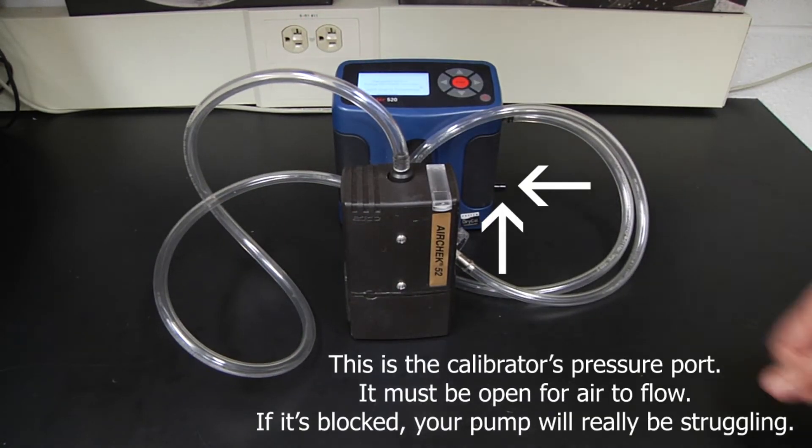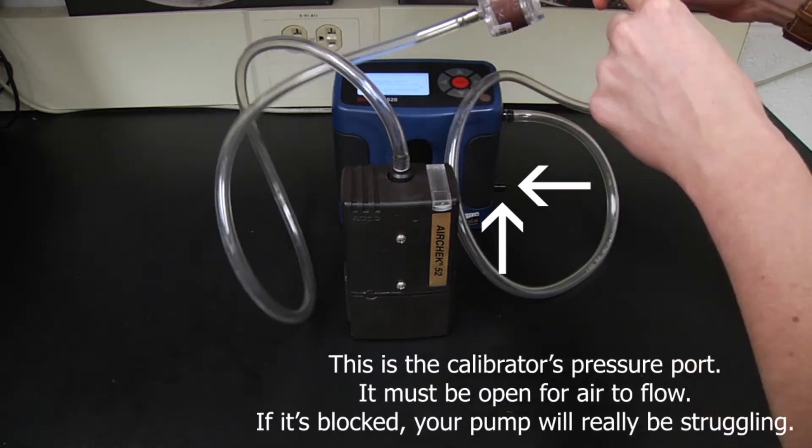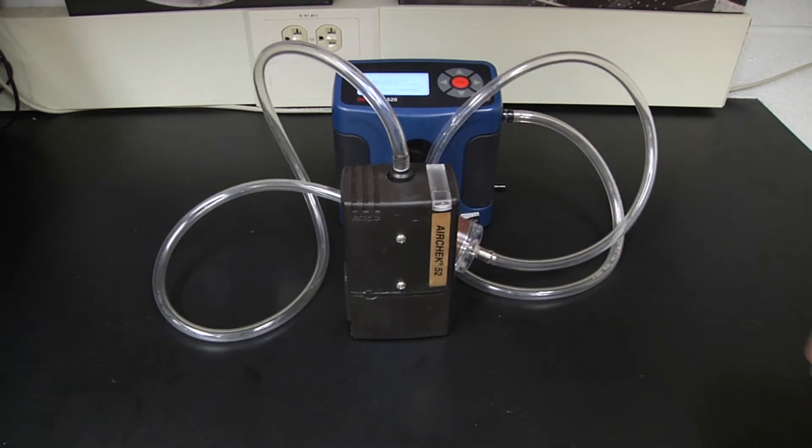If the pump seems unusually loud, there may be a blockage in your sampling train that's preventing airflow, so address that immediately.